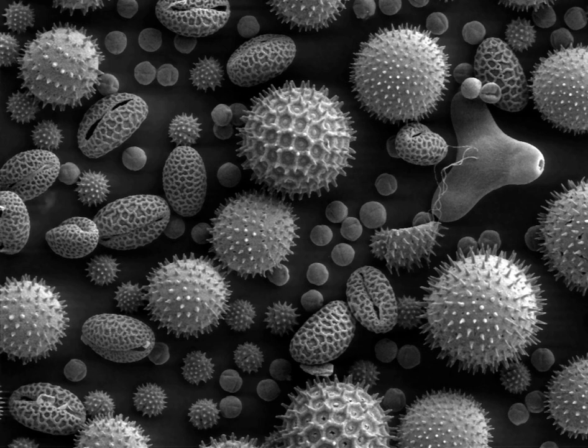Fractography is the study of fractured surfaces that can be done on a light microscope or, commonly, on an SEM. The fractured surface is cut to a suitable size, cleaned of any organic residues, and mounted on a specimen holder for viewing in the SEM. Integrated circuits may be cut with a focused ion beam or other ion beam milling instrument for viewing in the SEM. The SEM in the first case may be incorporated into the FIB. Metals, geological specimens, and integrated circuits may also be chemically polished for viewing in the SEM.